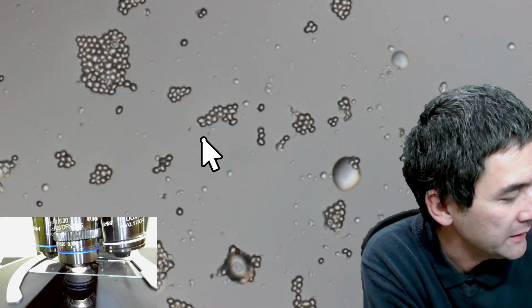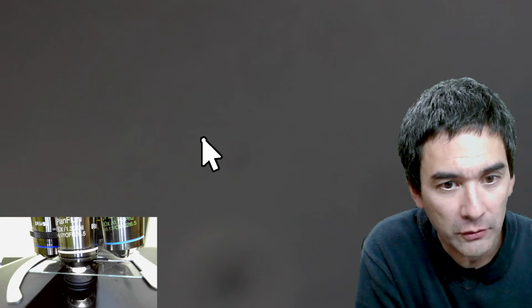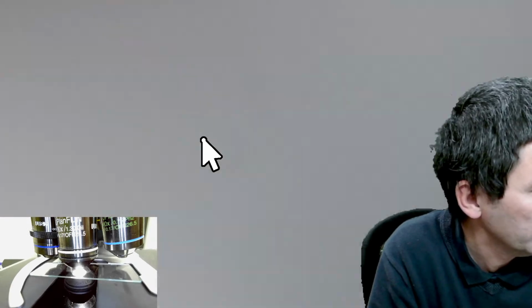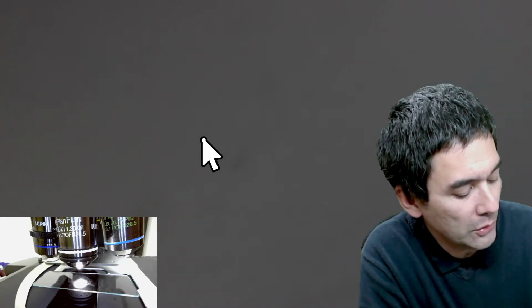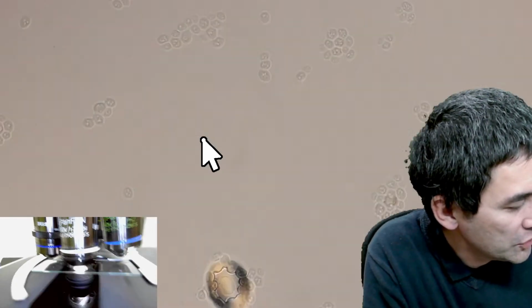Okay, so now let's try the oil immersion procedure. As before, I'm going to rotate the oil immersion objective in place. Notice that there is now no cover glass. The lock is now engaged. I'm going to lower it. There was already a little bit of oil on here, so let's put a little bit more oil. Of course, you always have to be aware that you do not know how the cells will react with the oil. So that could be something. And let me change to the correct setting over here.